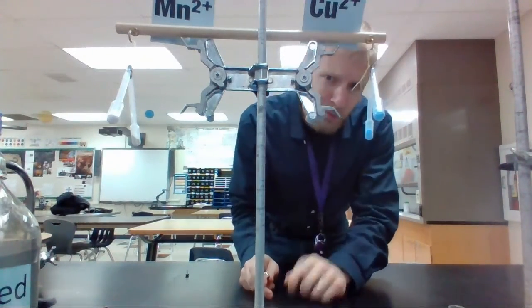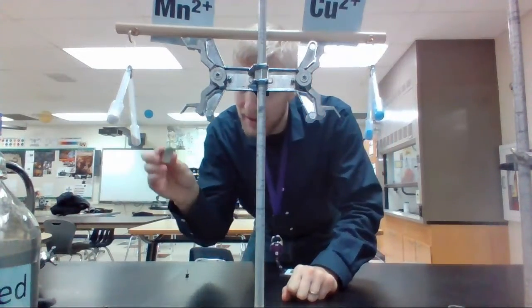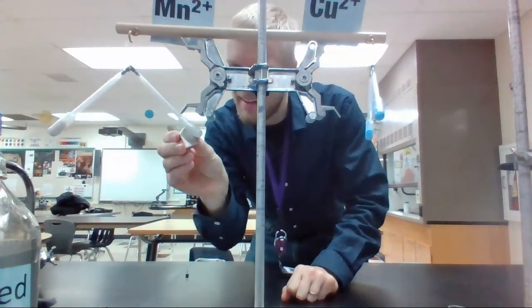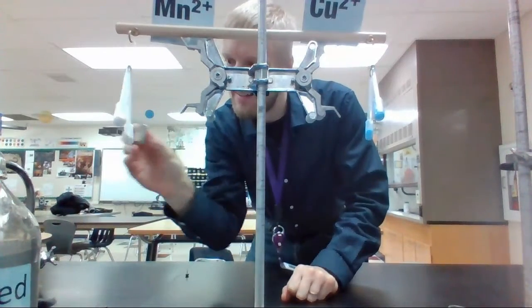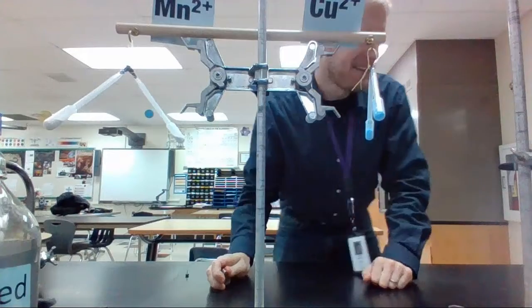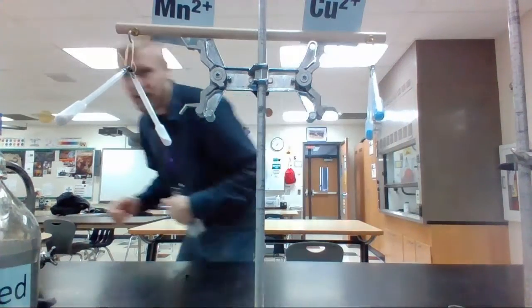Then we said manganese 2+ was the most paramagnetic. So, let's see that one. Whoa. Look at that. Isn't that awesome? Science. All right. We're going to scooch over to the next one.